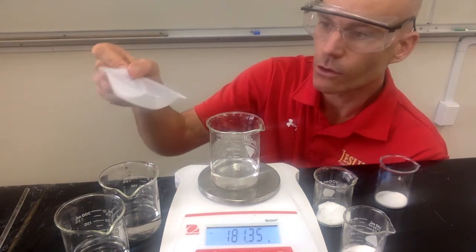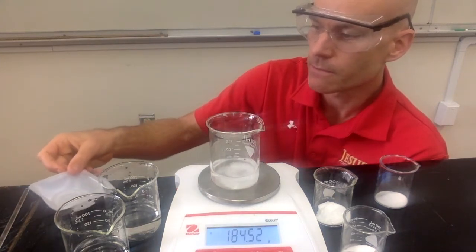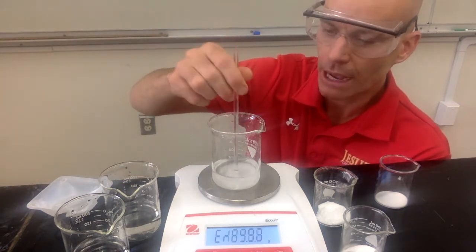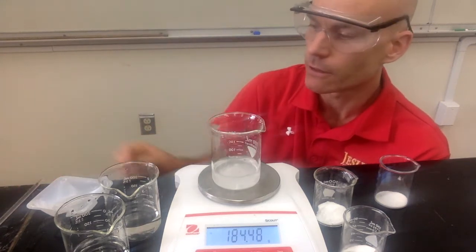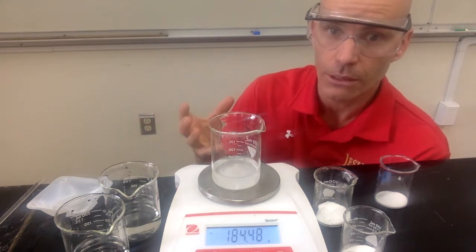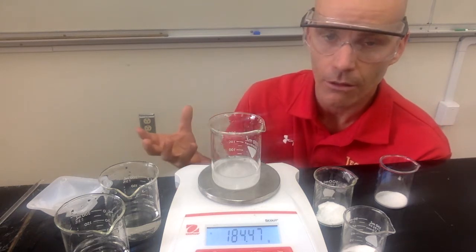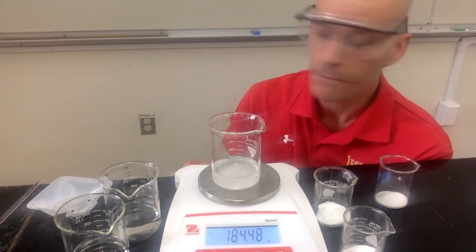So now I'm going to take my sodium chloride and pour that into my sample of acetic acid. And we'll see that really nothing happens. No reaction takes place. I'll stir it a little bit, but the total mass here should be exactly the same as the mass of the sodium chloride at the beginning plus the mass of the beaker with acetic acid in it. If you just add those two numbers together, it should come out to be the same mass as this. And that's because of the law of conservation of matter. We just mixed those two things together, but no reaction took place, no matter was created or destroyed, so it should still weigh the same as it did at the beginning.